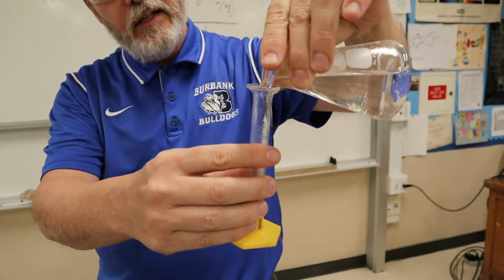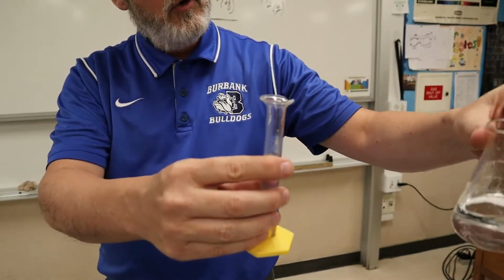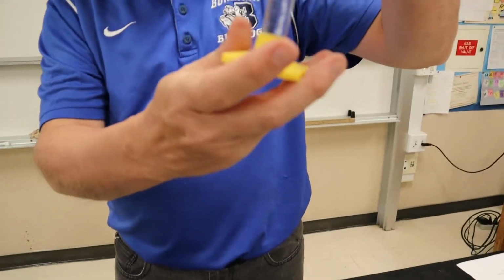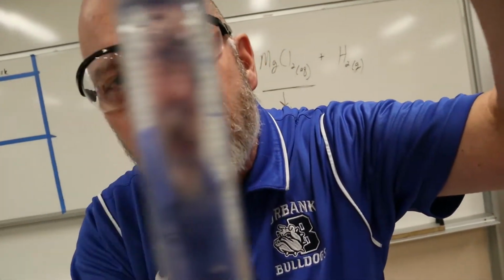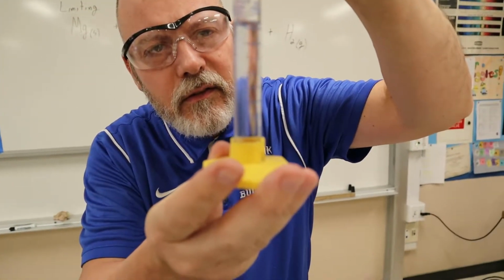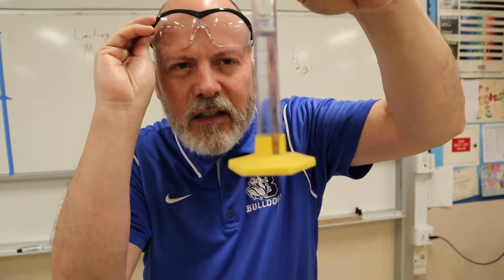What do you notice about acid, boys and girls? It looks just like water, right? So you don't want to go into a chem lab and go, oh cool, I want to drink this. You'd be like, ah. Okay, or touch it. All right, so I poured between, it's hard to see, you can probably see better with the camera, but that looks like maybe 9.4 something? Am I looking at that right? Yeah, about 9.4.